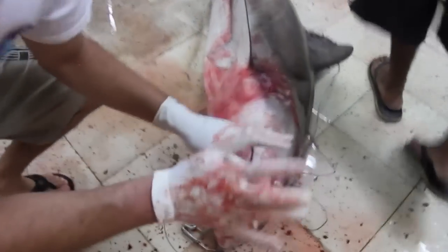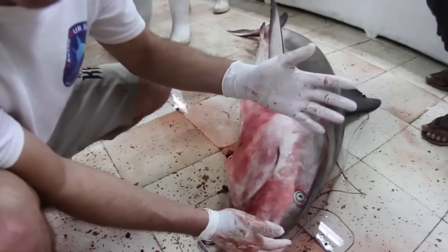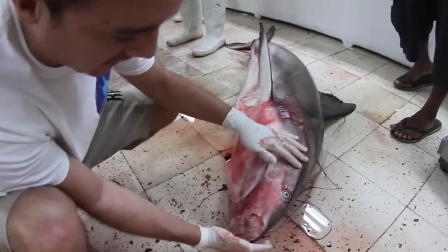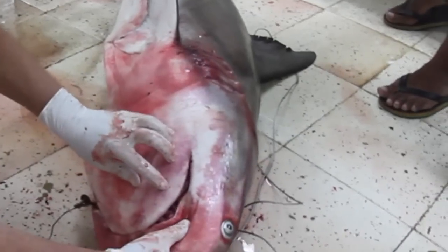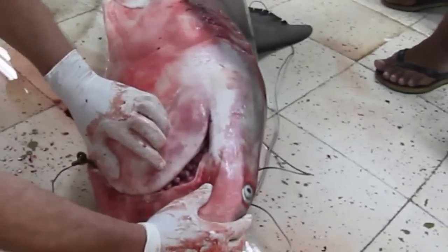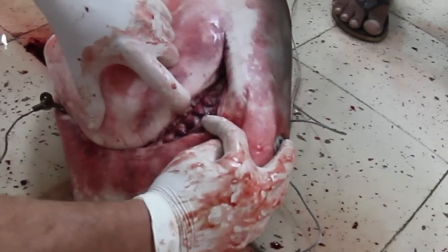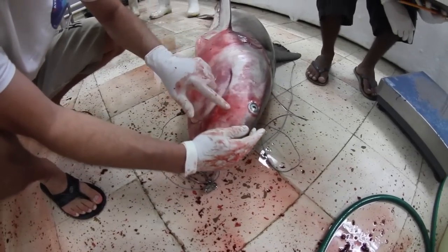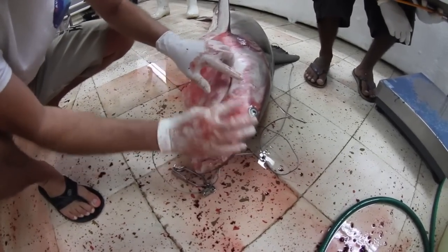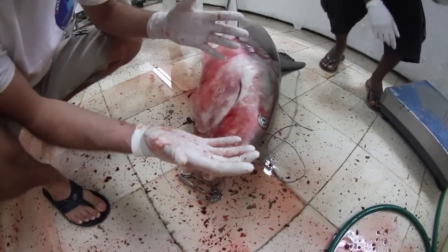Tiburón Toro — the Bull Shark. Here are the ampullae of Lorenzini; with these you can detect the electromagnetic fields generated by prey.